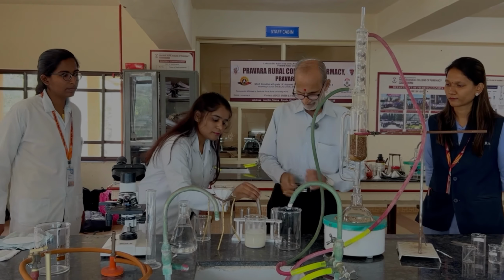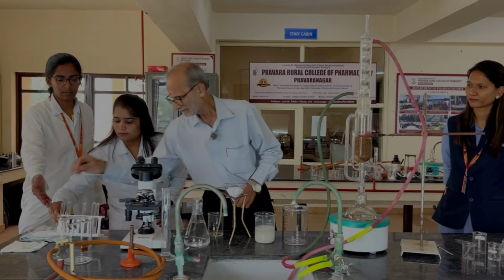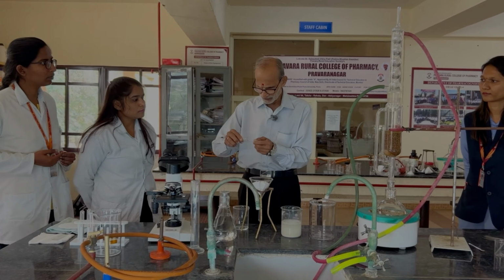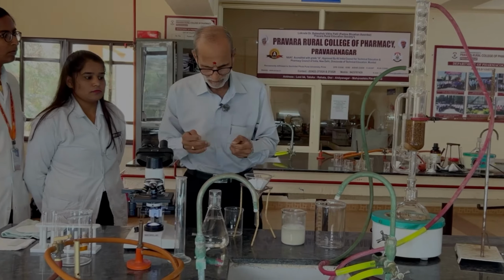Okay, good. You can also see this under a microscope. So what we will do is try to capture the starch grains under the microscope. The same starch grain we will try to capture under the microscope. Cover glass.